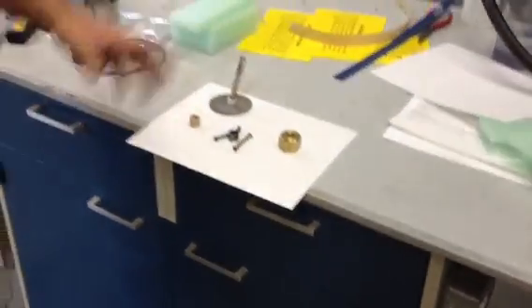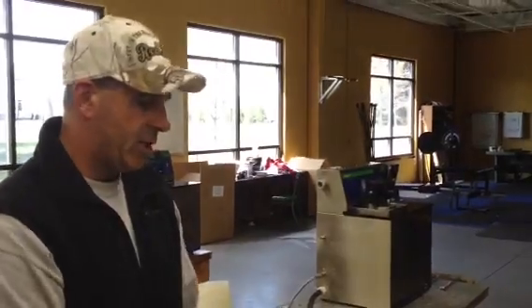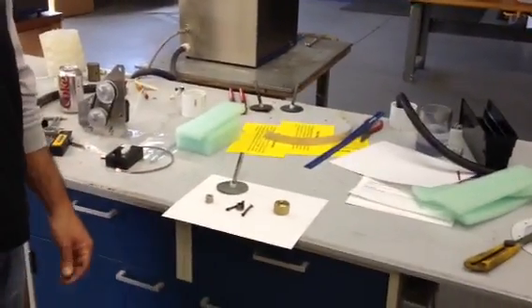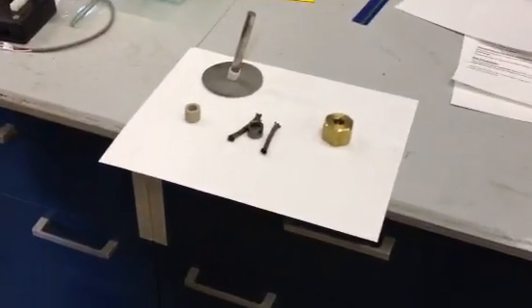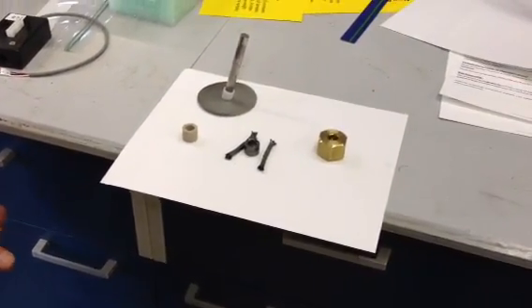Definitely, yeah. This is one of the most common problems with the machines, just from the customer not tightening the packing, and as soon as you get any leakage, it seems to progress. Very important to explain to the customers when they change the packing to adjust it every 40 hours, or at least look to make sure there's no leaking. And with the clear back on that A2000, it makes that job a lot easier.